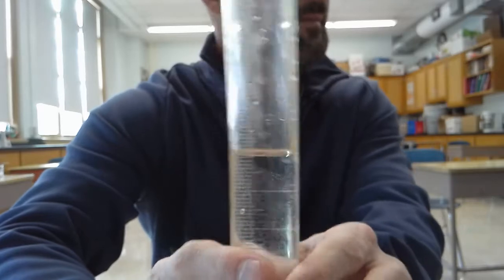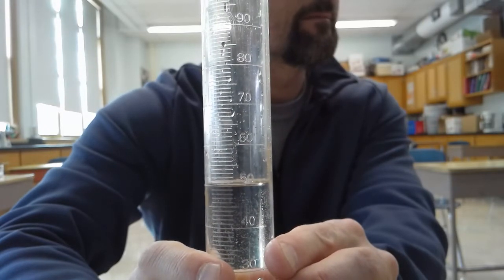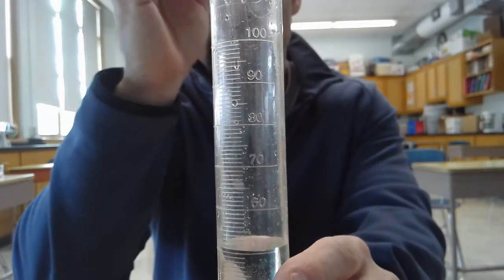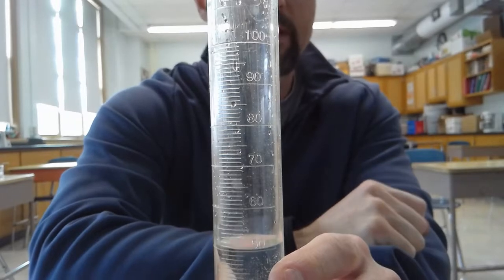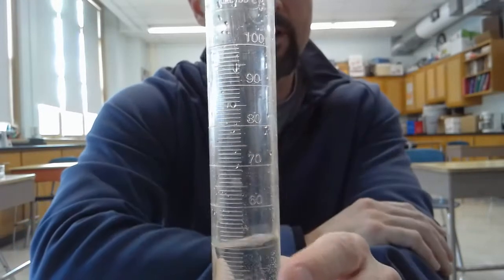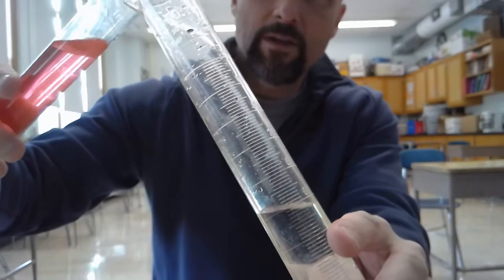I have water, kept as a clear liquid, and if you notice it is right at 50 — the bottom of the meniscus is right at 50. So when I add these together — a liquid-liquid mixture — with the naked eye it looks like one substance. But what happens when you mix two different liquids together? Through your magic glasses, alcohol and water are probably not the exact same particle. But what's between the particles? That's what we're looking for.